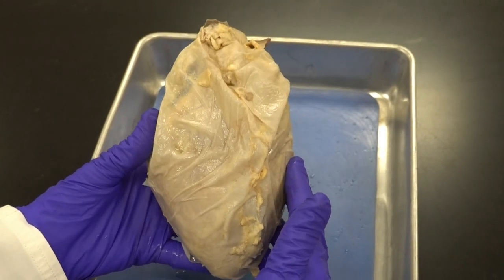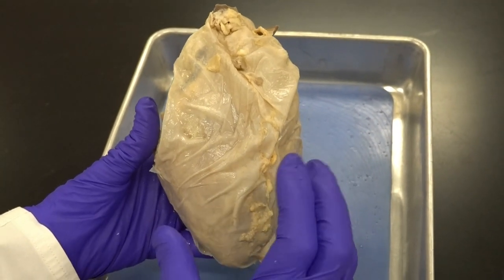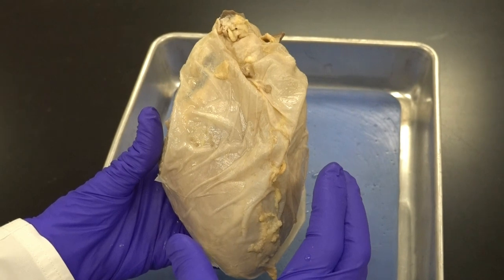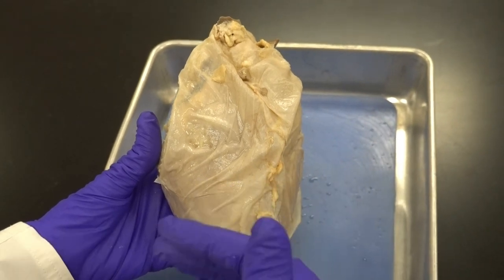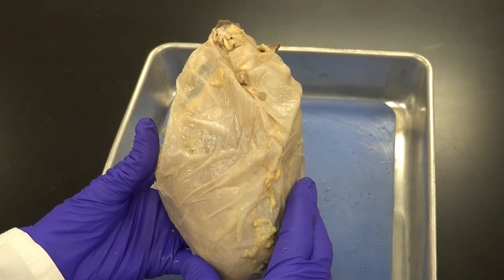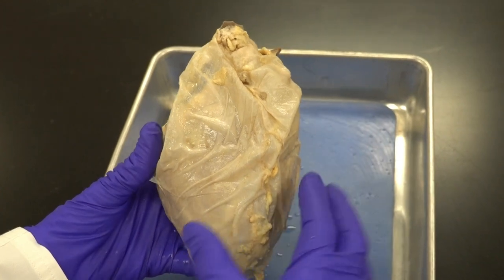Here I have a pig heart. The reason I chose a pig heart is because genetically pigs have many similarities to humans, and as you know, the valves of a pig heart are still used for some of our patients.